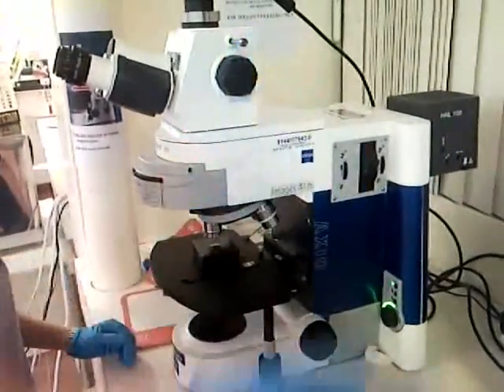Use an optical microscope to view and find graphene. Graphene appears as a purple spot on the screen. At the center of the screen is multi-layer graphene, and at the lower right corner of the screen is single layer graphene.